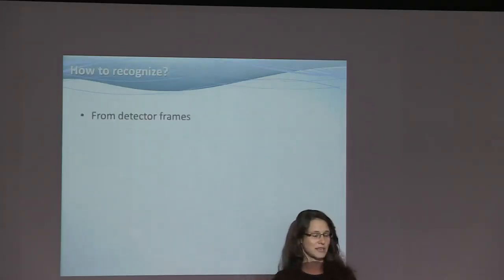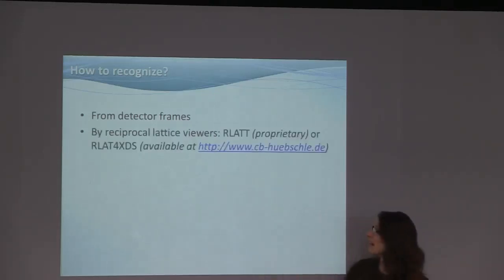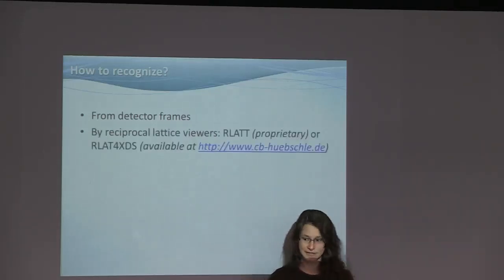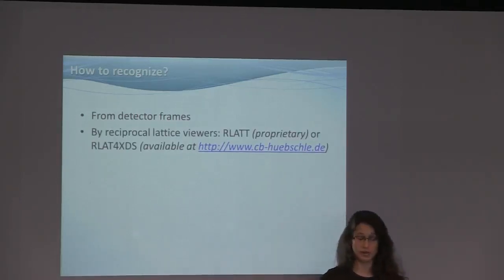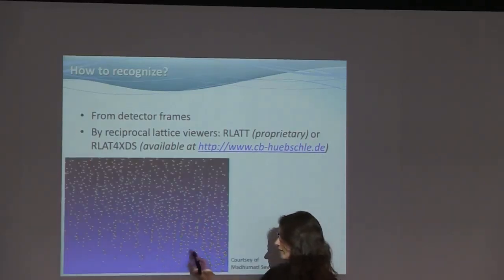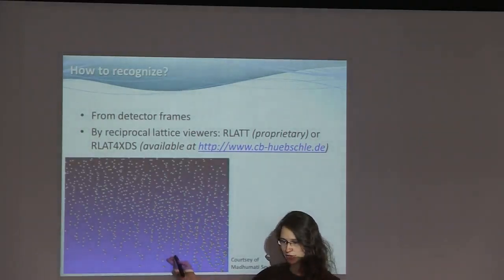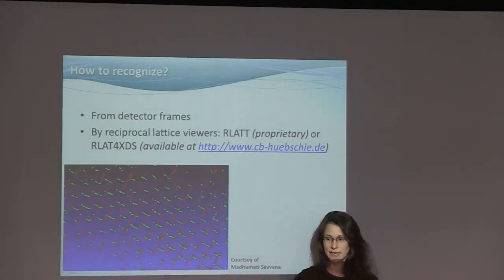So you can recognize this from detector frames, because you're not seeing nice lunes, you actually see something that you really think is strange. You can also look at a reciprocal lattice viewer. Missing from this slide is the DIALS reciprocal lattice viewer, which will allow you to identify such twins. In a reciprocal lattice viewer, you would have the reciprocal lattice looking like this, pretty chaotic, but you can already see there are two different main directions. And if you index and color them differently, and orient them correctly, you can quite clearly see these are two arbitrarily oriented lattices on top of each other.